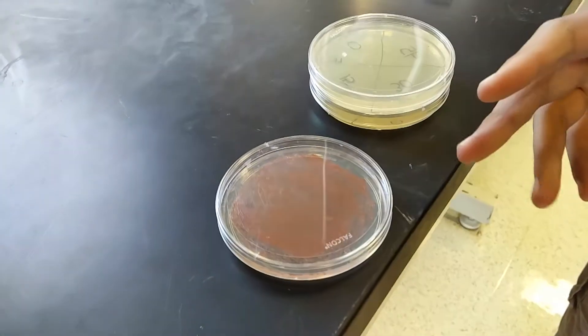Today I'm going to be showing you how to UV mutagenize Haloferax volcanii and observe for photo repair. What you'll need for this experiment is one master plate from which you'll get your cells.